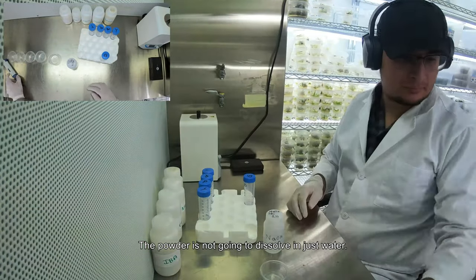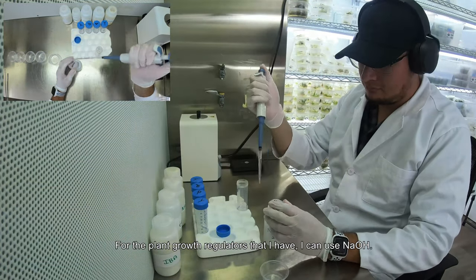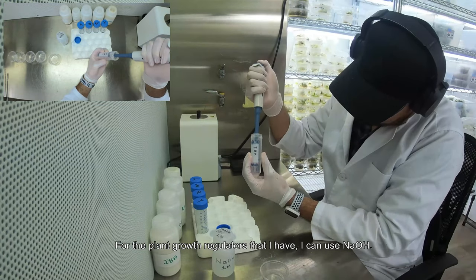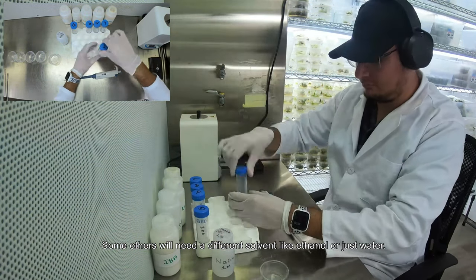The powder is not going to dissolve in just water. You are going to need a solvent. For the plant growth regulators that I have, I can use sodium hydroxide. Some others will need a different solvent like ethanol or just water.